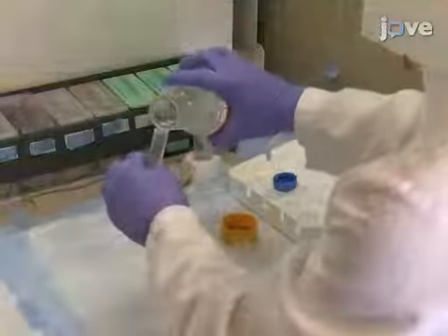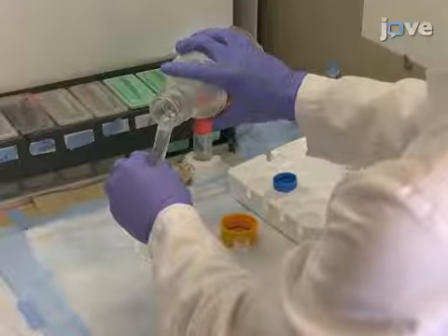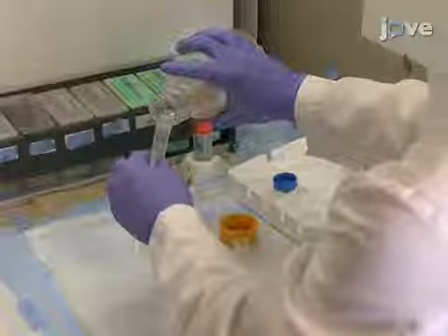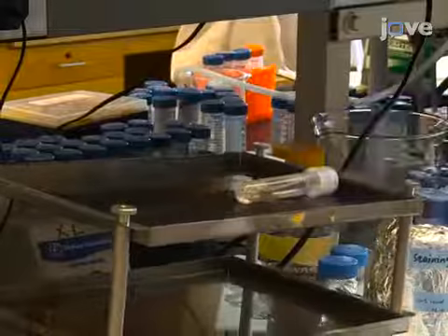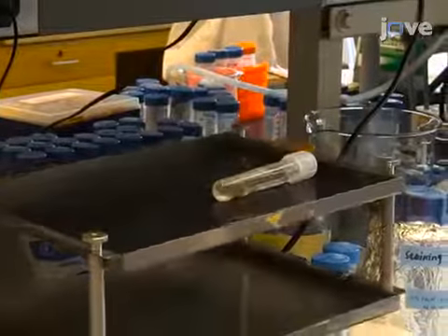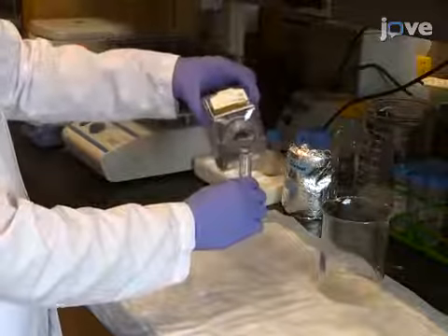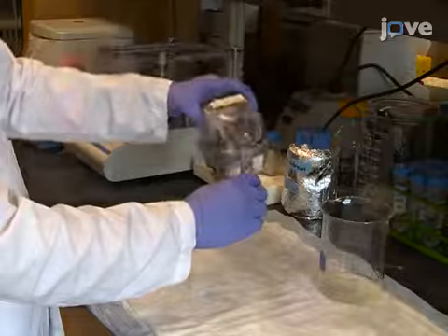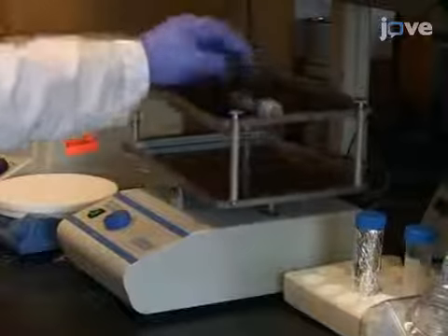At the end of the incubation, transfer the specimen to 10% formalin and leave on the rocker for another two days. On the third day, wash the sample in PBS for three five-minute washes.